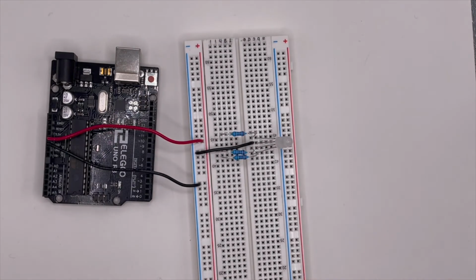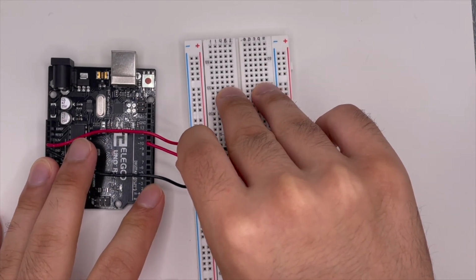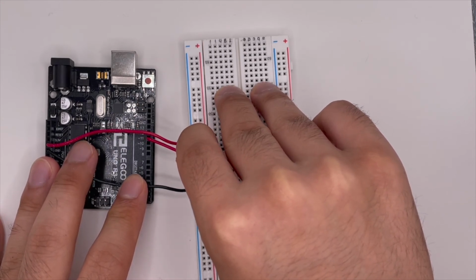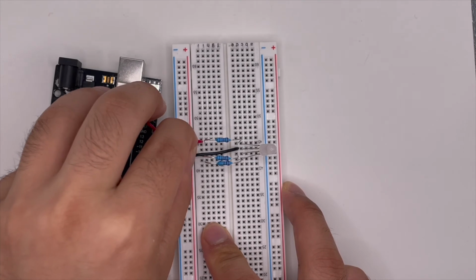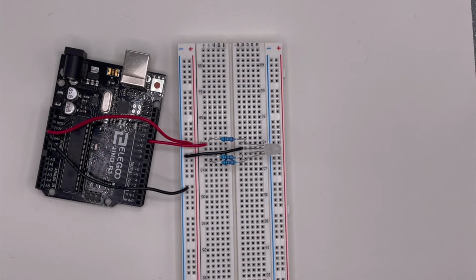Okay. Next, we now need to connect the wires from the breadboard to the Arduino for the LED. So we will be using more wires. Let's start with the red pin. The red is going to pin 11. So from pin number 11, here we go, 11, we're going to go over and find the red lane there.